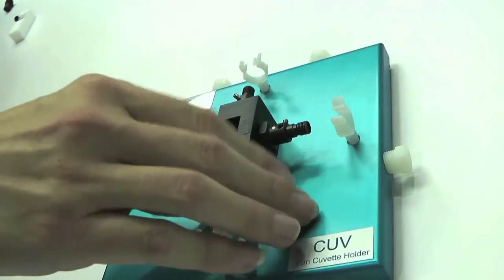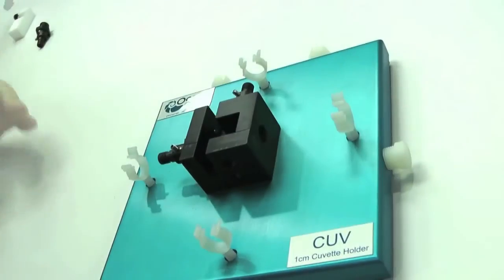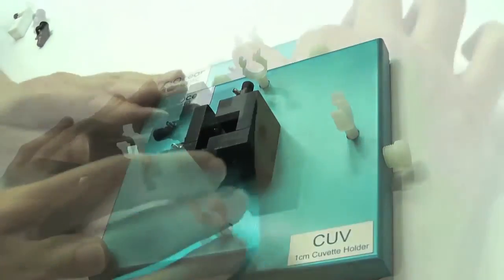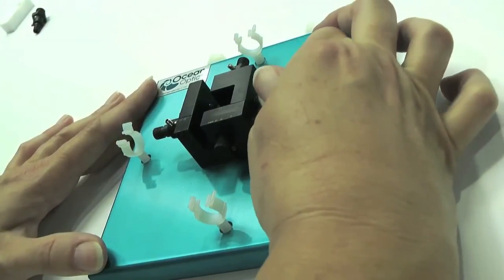Using your CUV cuvette holder, you can replace two of the 74 UV lenses with the two mirrored screw plugs provided, which reflect light back through the sample in order to enhance the fluorescent signal.